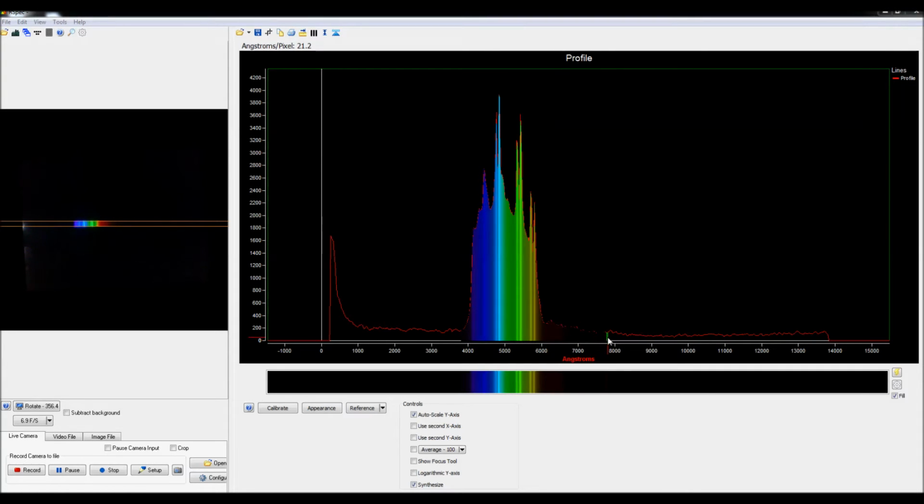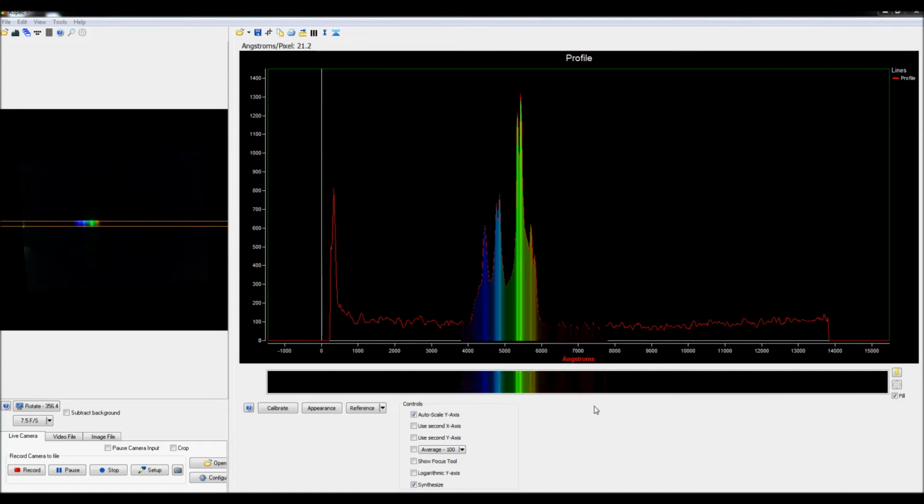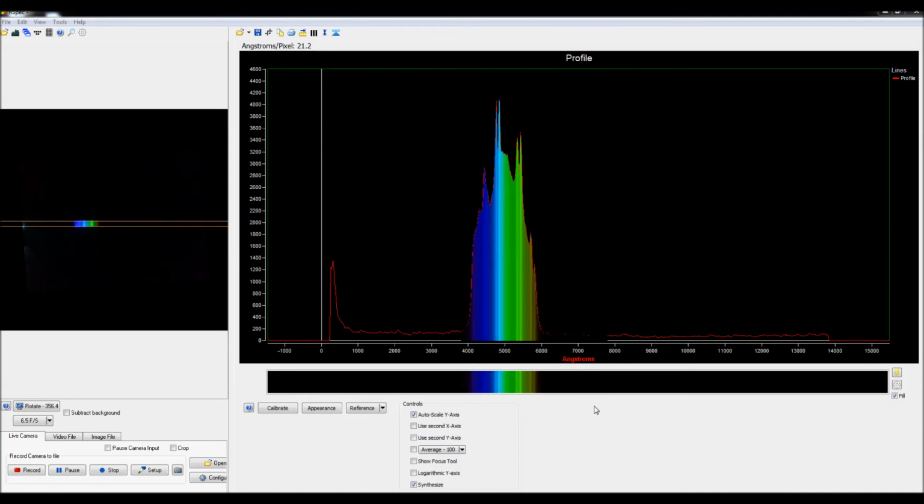And you'll see in here where into the red and infrared that there is almost no spectral lines where I would expect them. All of the rest are in the mercury vapor zone. Now I'm going to go ahead and drop in some copper sulfate. And you'll see it does absorb whatever is left of the red spectra, but there wasn't really enough there for it to make any difference or be able to see anything.